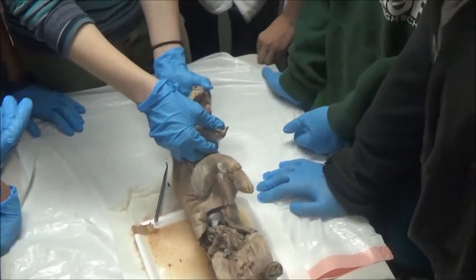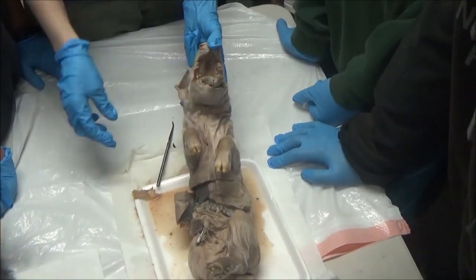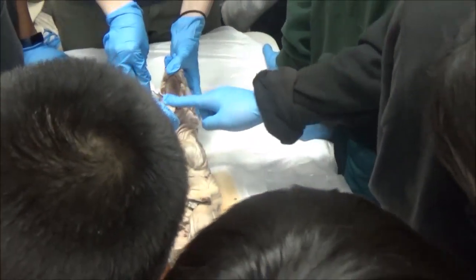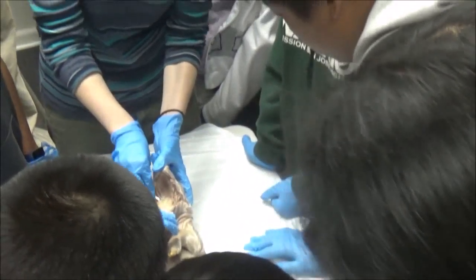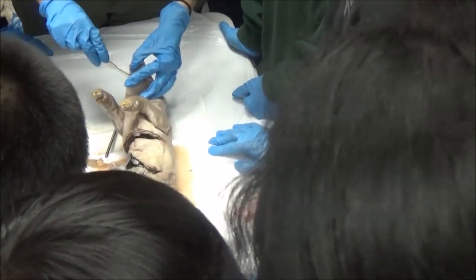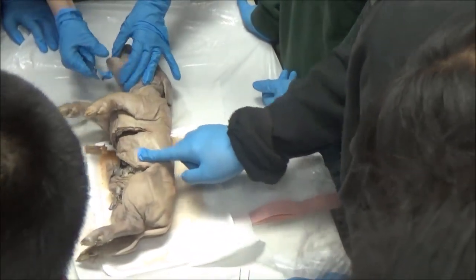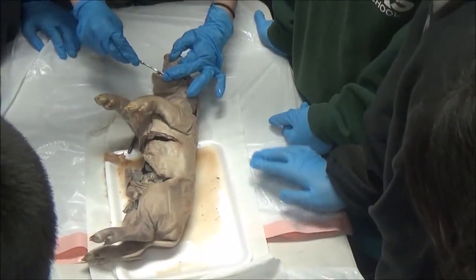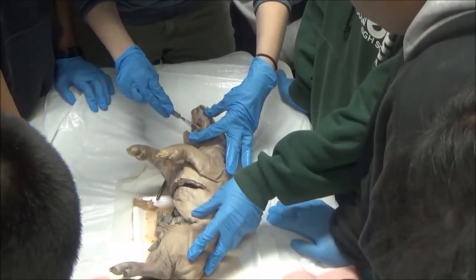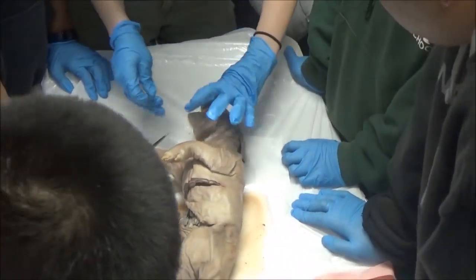You can't really see the holes — you have to really get rid of the tongue and really slice in. You can't lick the tongue; you can't put any of this in your mouth because it's really not good for you. I need to cut the underside. The tongue is mostly one really thick muscle — I'm straight up cutting it out. As we're cutting away, we're seeing blood vessels and tendons, because muscles need tendons to function. We're also going to see some salivary glands.